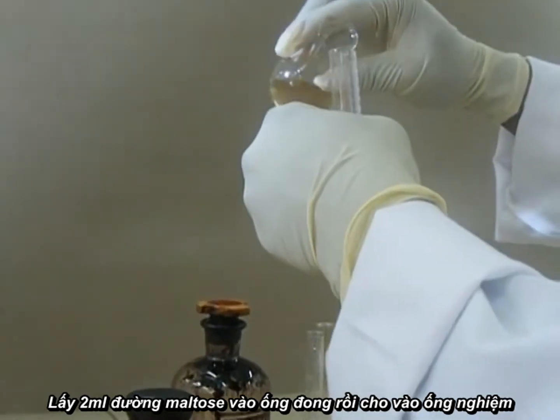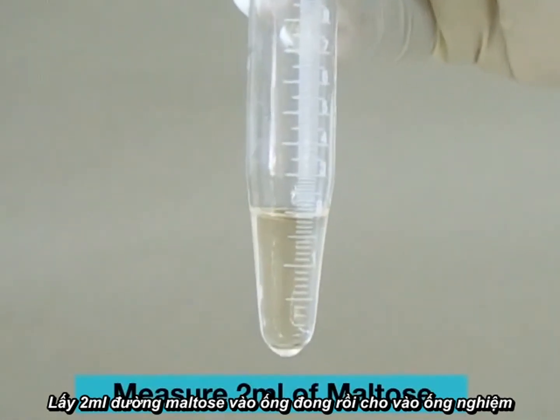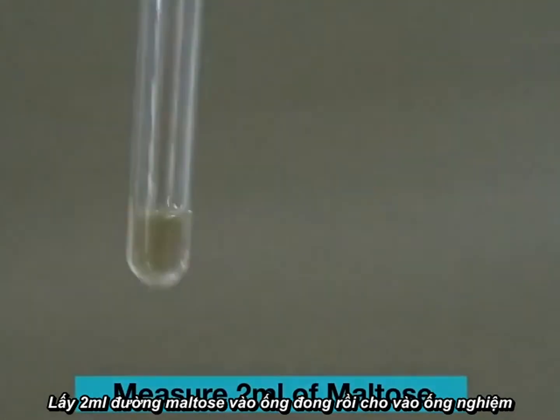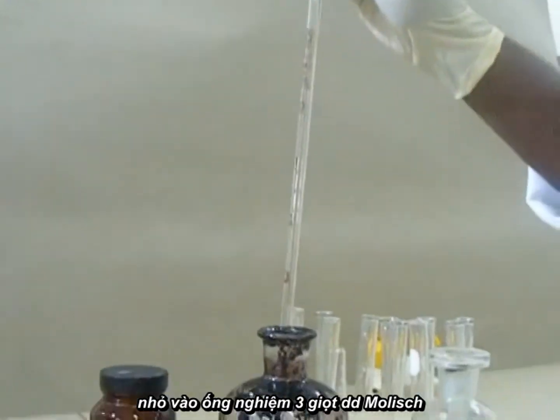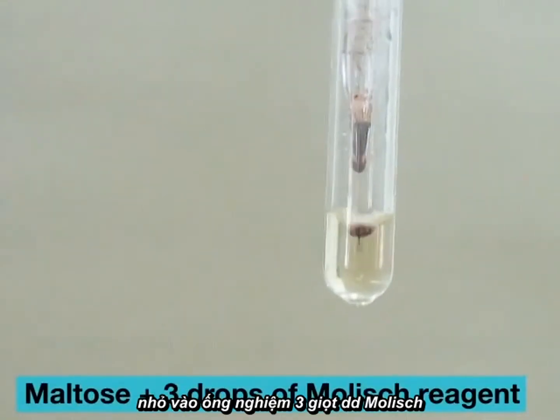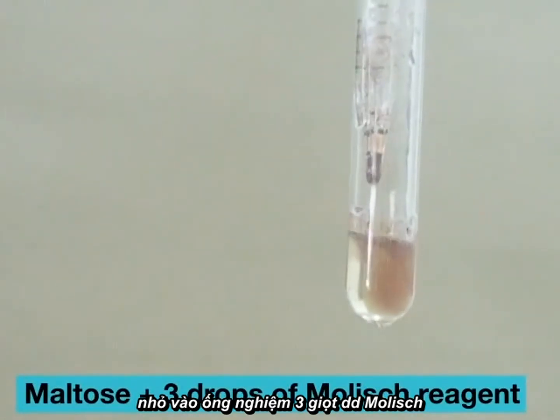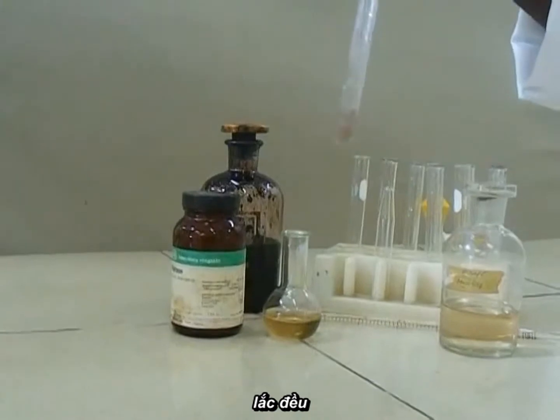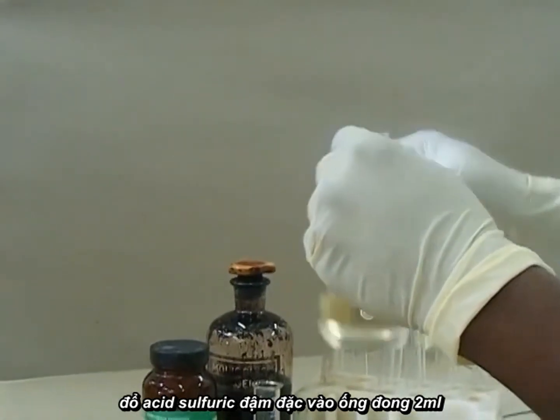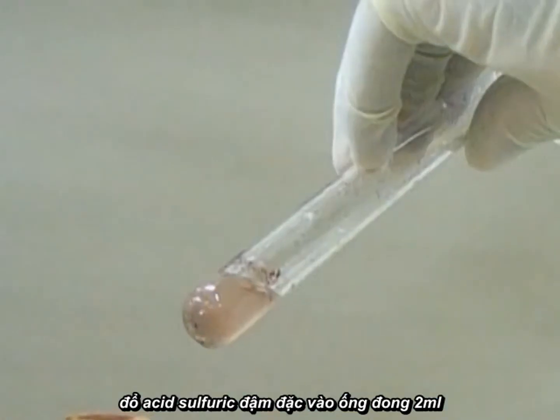Test procedure: Measure 2 ml of maltose, a carbohydrate, into a test tube. Add 3 drops of Molisch reagent. Swirl to mix, and run 2 ml of concentrated sulfuric acid slowly along the inner wall of the test tube.